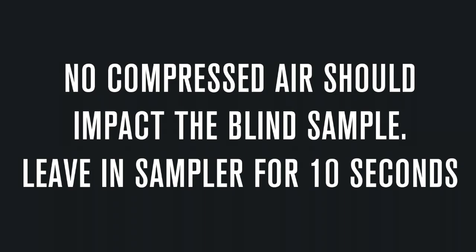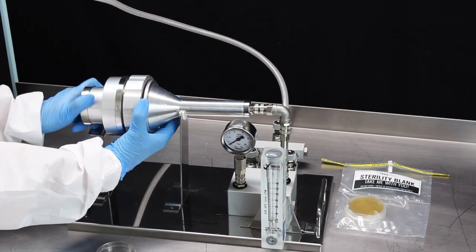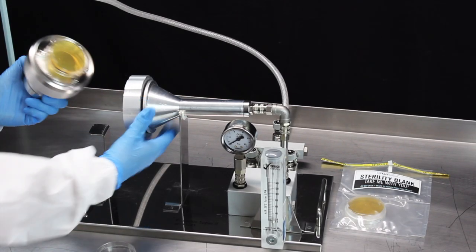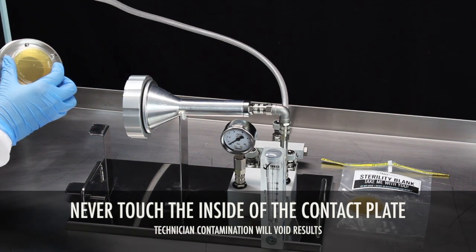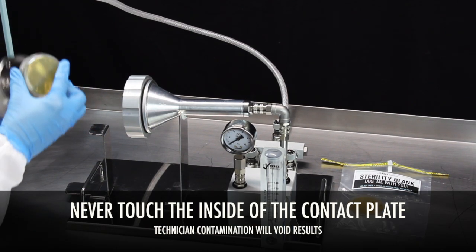After 10 seconds, unscrew the contact plate housing and immediately and carefully place the lid back on the plate. Rotate until locked. Do not touch any exposed portion of the contact plate.